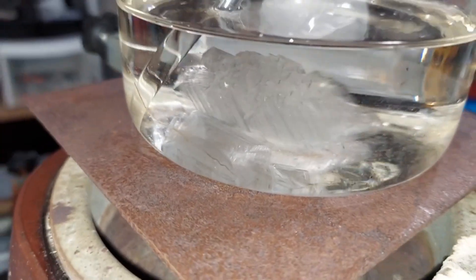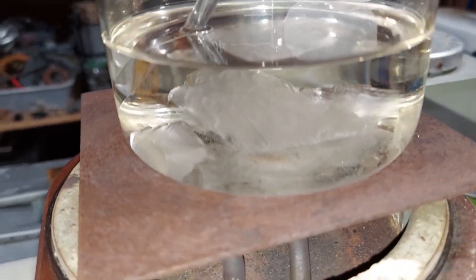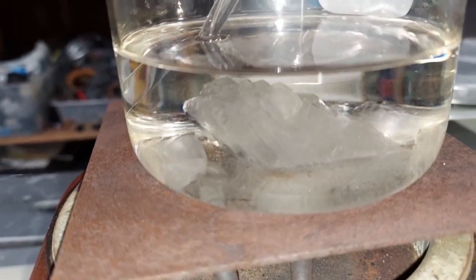Which dropped to 21 degrees. Here in the morning you can see these crystals that have formed. This is concentrated sulfuric acid crystals.